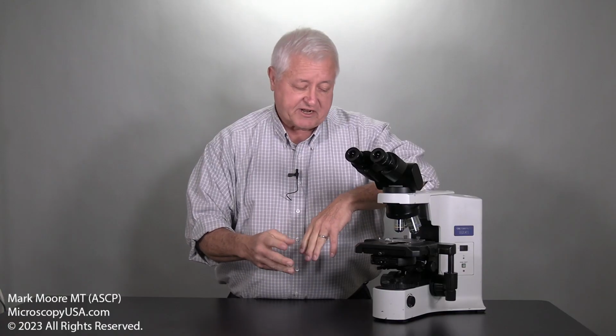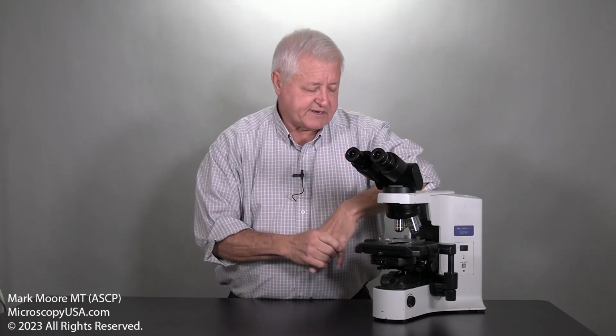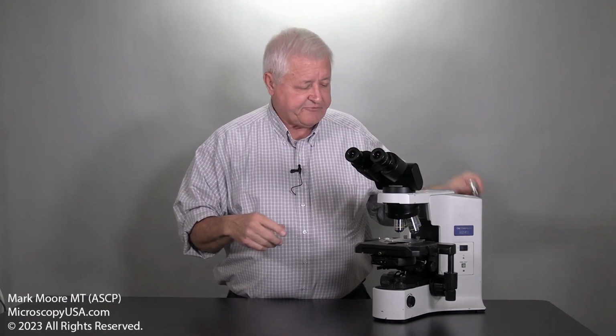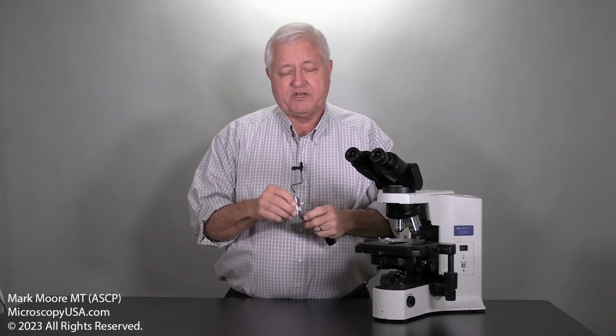Well, the first thing is you've got to service the microscope completely and clean the objective properly. There's a very specific way to do that. In our series of videos, we cover all that, the alignment and how to clean and get everything really ready to go. But if you suspect you have an oil damaged objective and a bad image, many things can cause a bad image, but one thing you can do is take the objective off the microscope, and there are two ways to see if it's oil damaged.